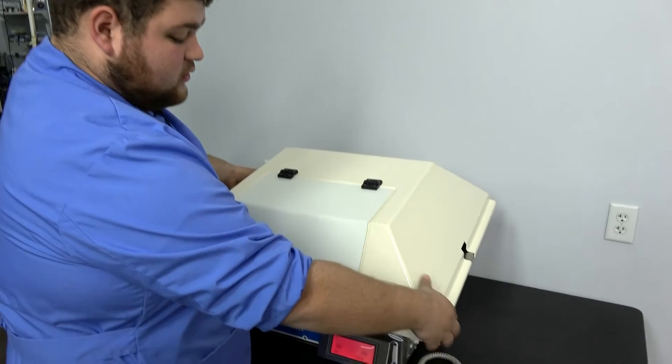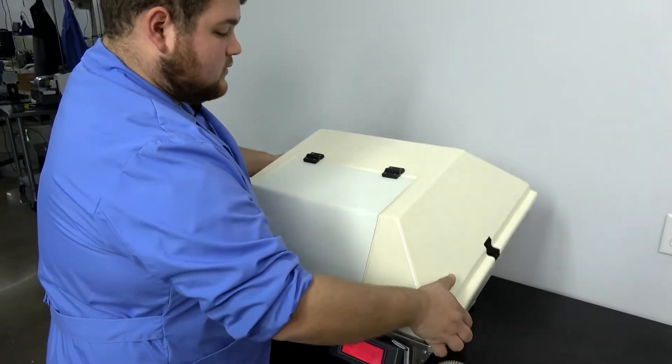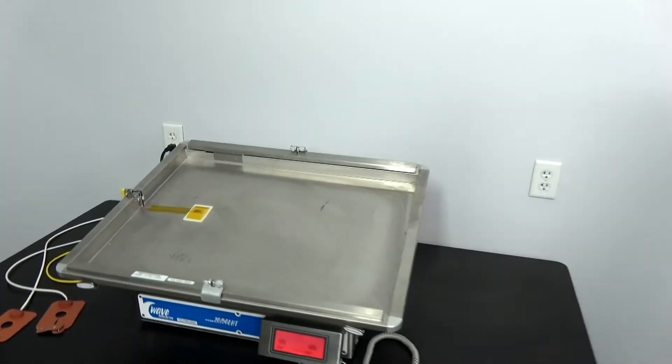This lid here is quite easy to remove. All you got to do is lift up like that. Set this off to the side.